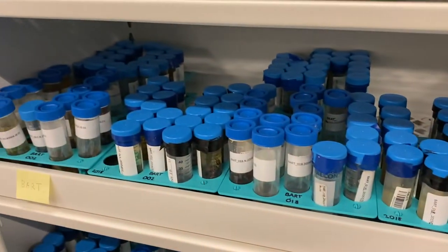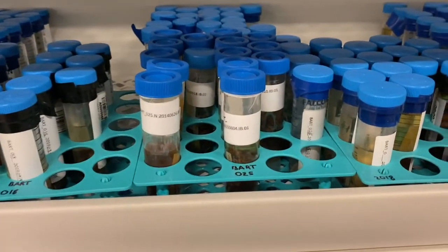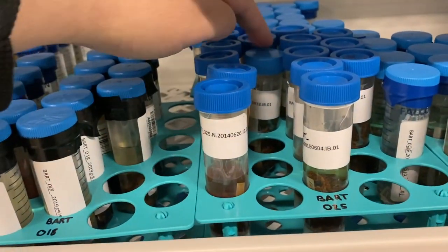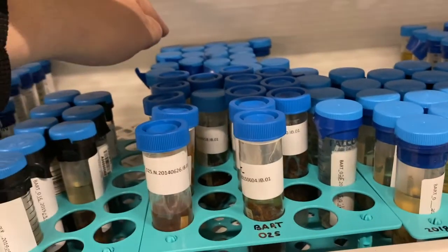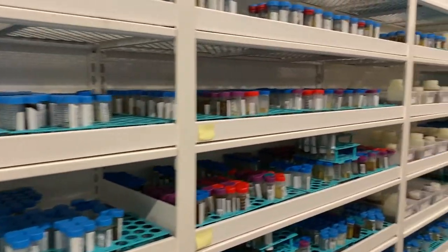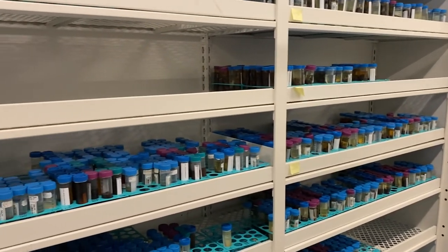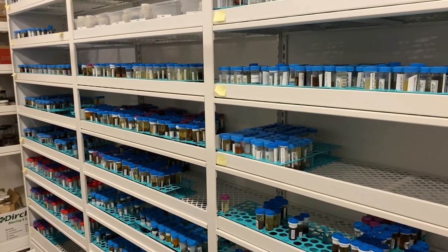Here we can see Bartlett Experimental Forest with the different plots — 2, 18, 25, and so forth. Within these, each individual sample is chronological by collecting bout within a rack and by years, then they move on to the racks behind it and snake over. This is repeated for all terrestrial sites where carabids are pitfall trapped. This is just the invertebrate bycatch, which continues on to the next row, and then we start the ethanol-preserved carabids and vertebrate bycatch.